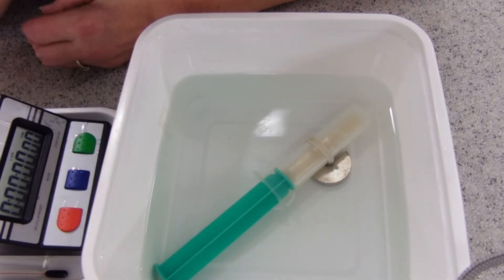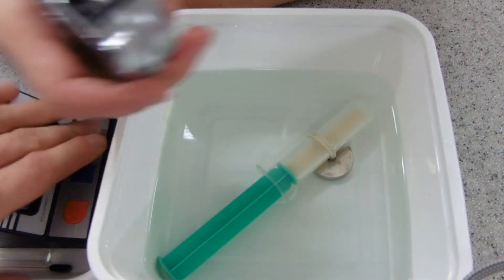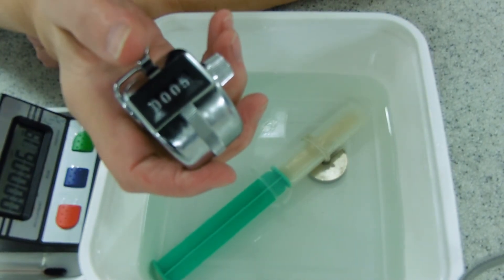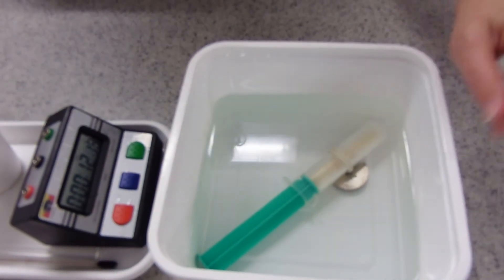When the yeast is bubbling at a constant rate, we're going to use one of these counters. As we click it, it'll count the bubbles for us — every time I see a bubble, I just click that. We're going to do that at five different temperatures.